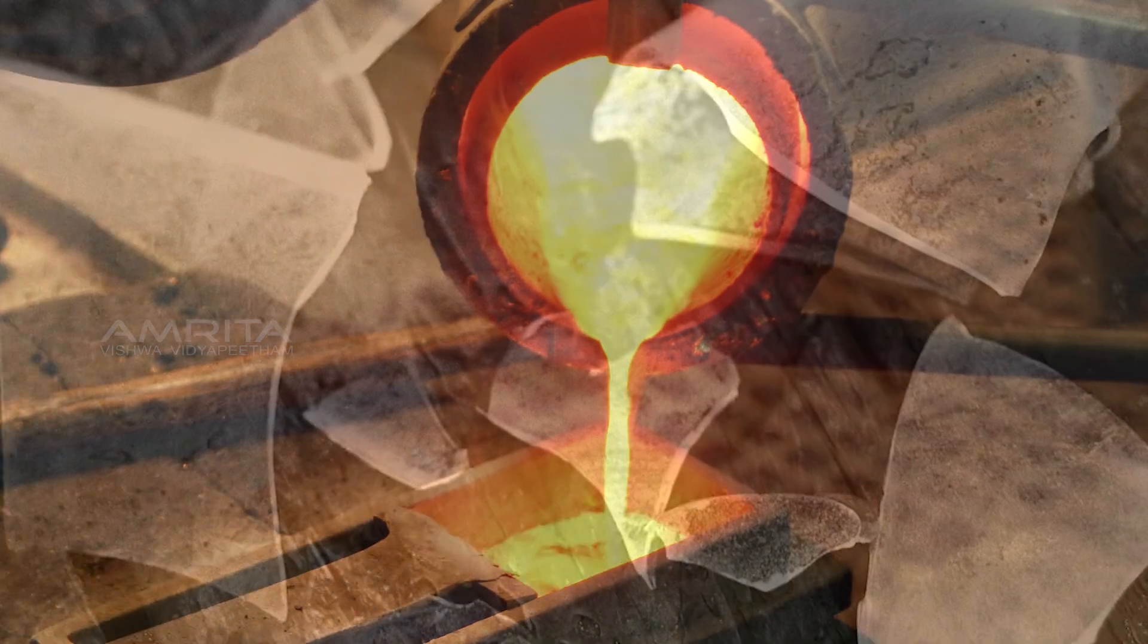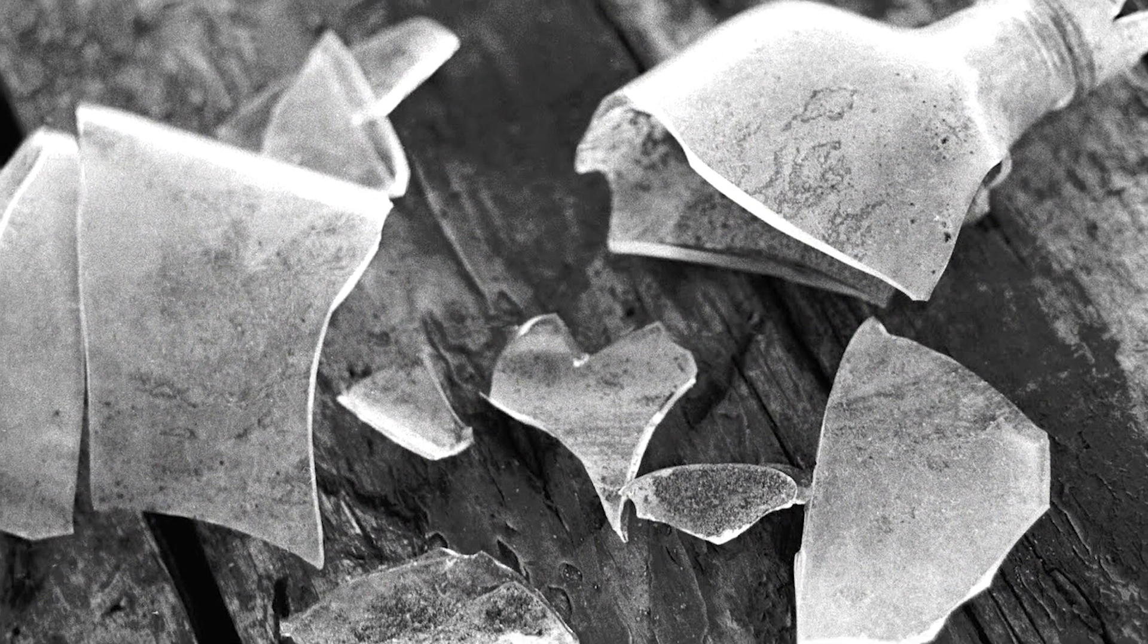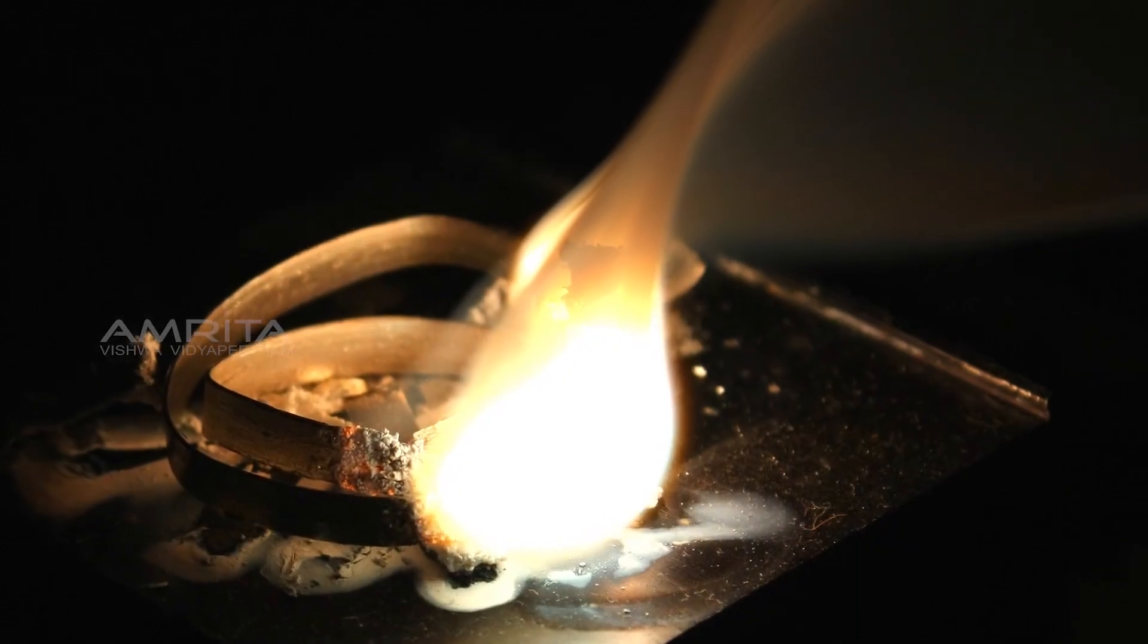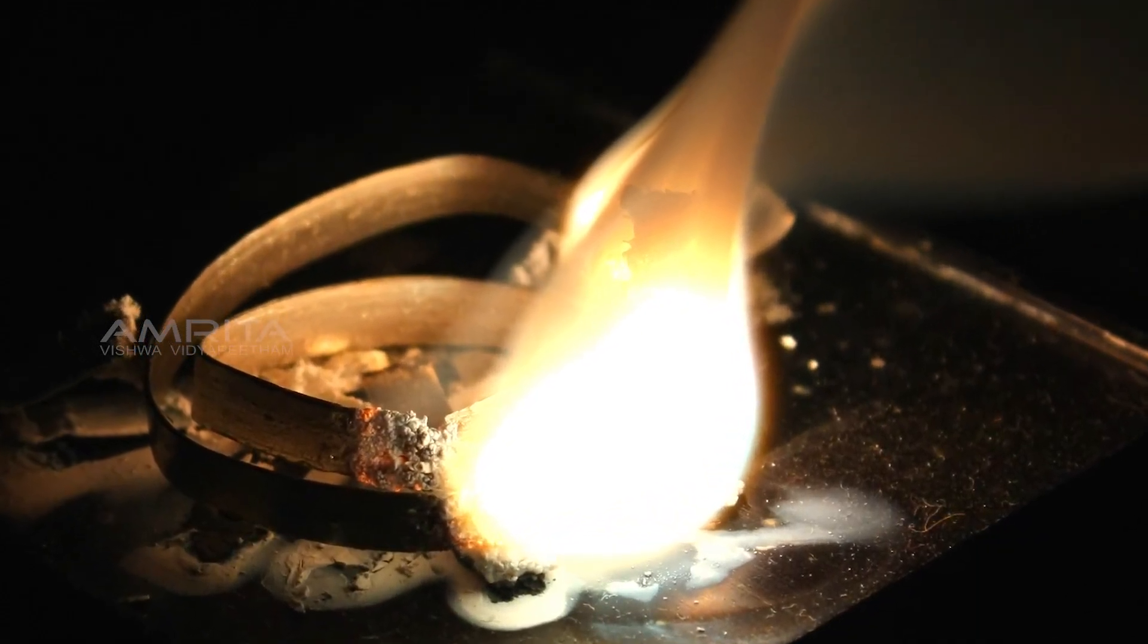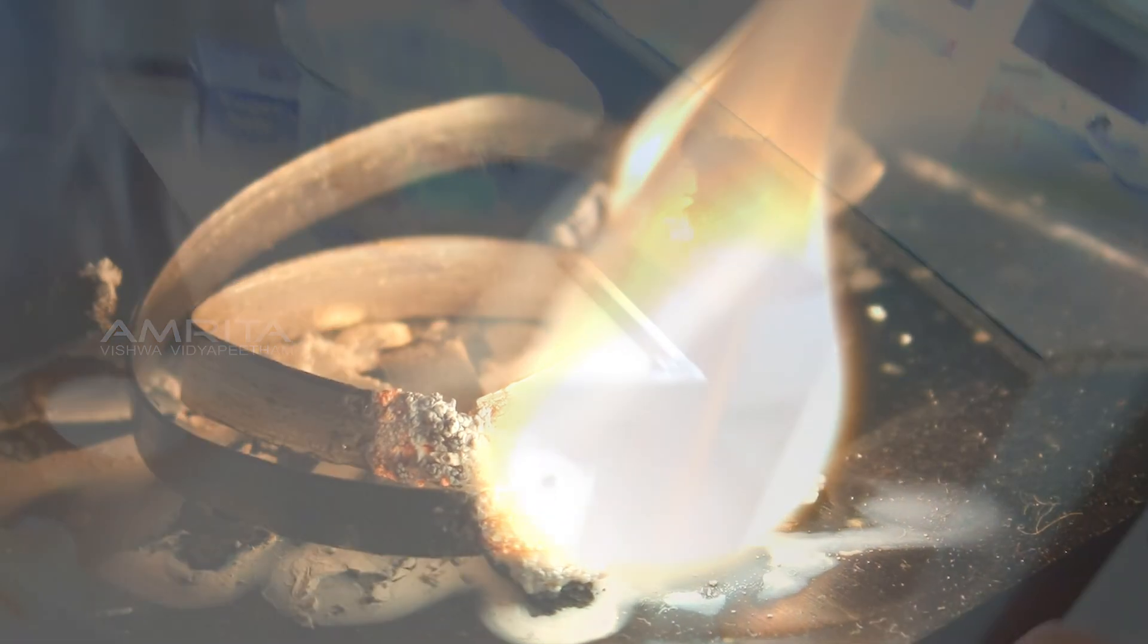Our aim here is to carry out the reaction of burning magnesium in air and classifying it as a physical or chemical change.